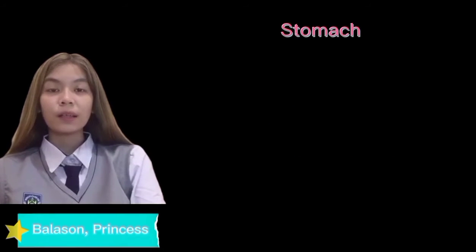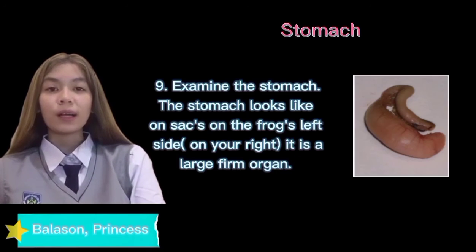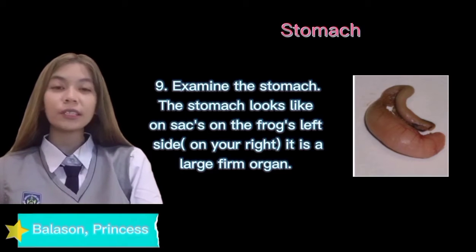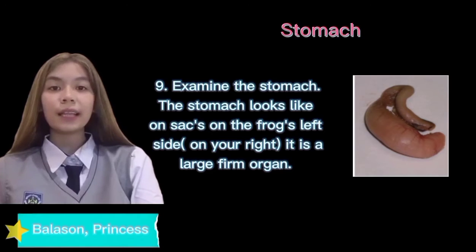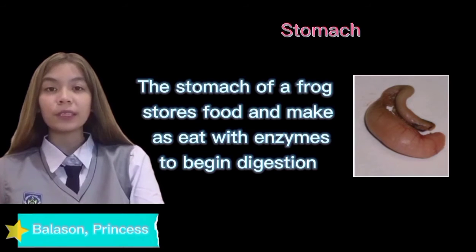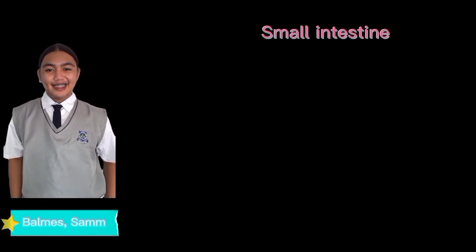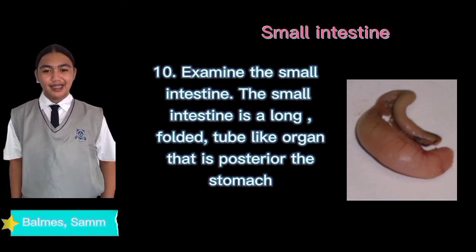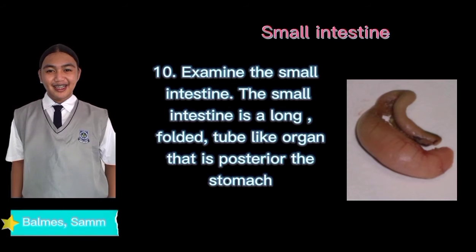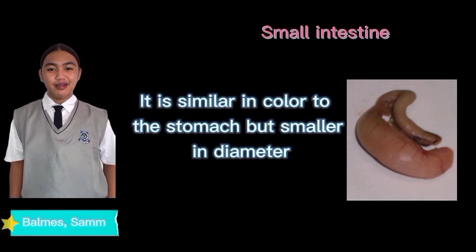Next is the stomach. Examine the stomach. The stomach looks like a sac on the frog's left side, which is on your right. It is a large firm organ. The stomach of a frog stores food and mixes it with enzymes to begin digestion. Small intestine. Examine the small intestine. The small intestine is a long, folded, tube-like organ that is posterior to the stomach. It is similar in color to the stomach, but is smaller in diameter.